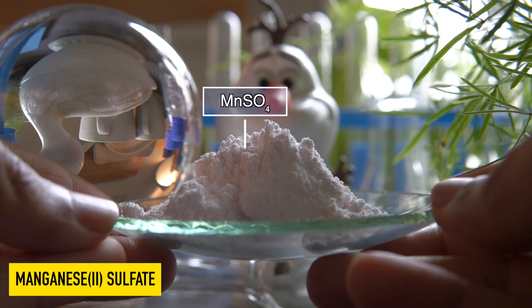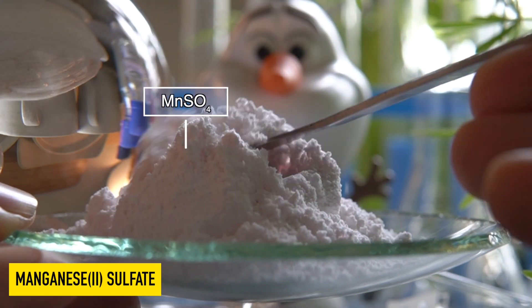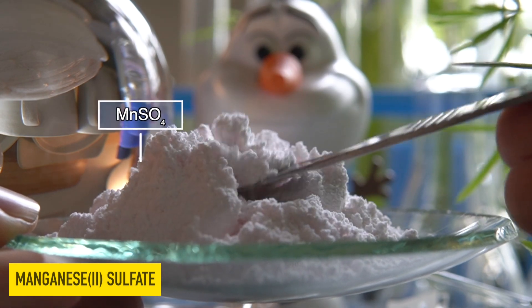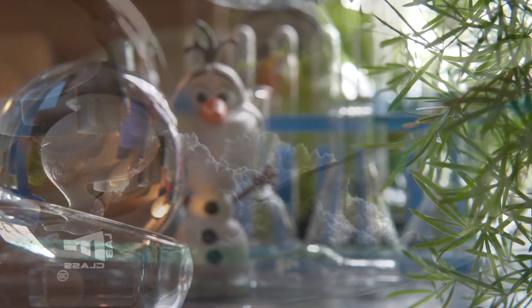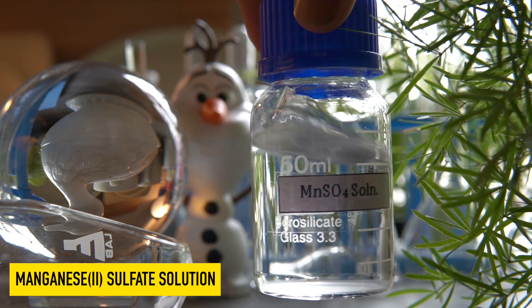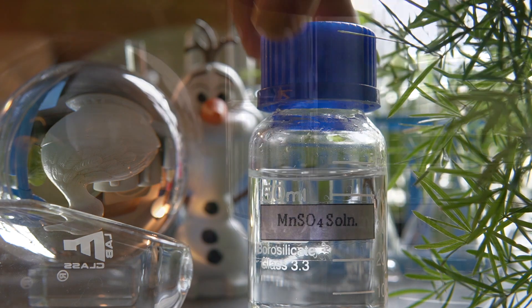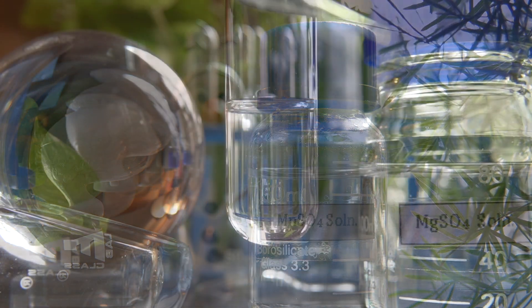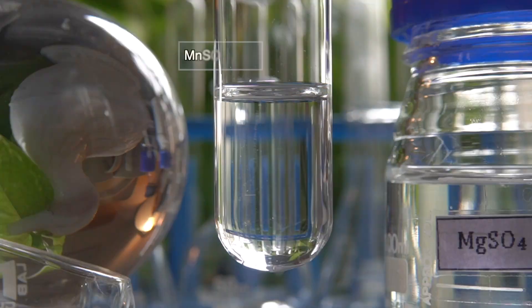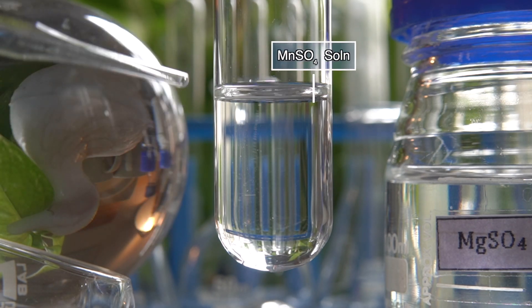This is MnSO₄ salt, slightly pinkish in color and highly soluble in water, so it can easily dissolve in water to make a homogeneous solution. To initiate the chemical reaction, we will take some amount of manganese sulfate into this test tube.